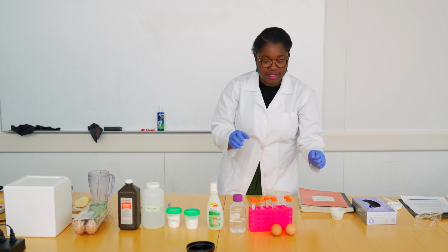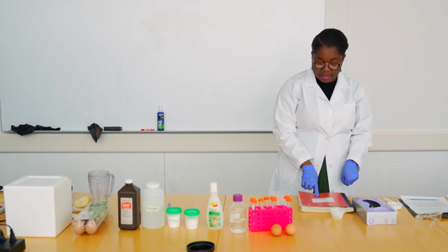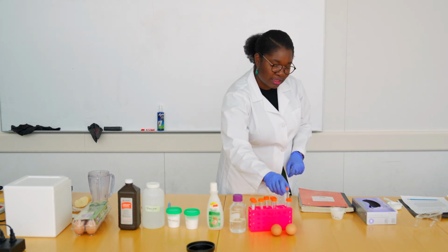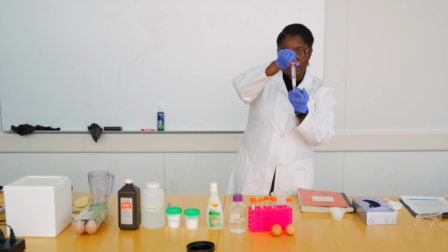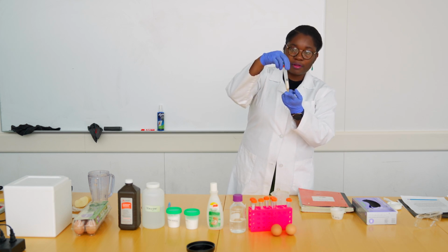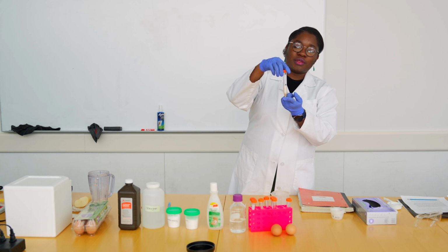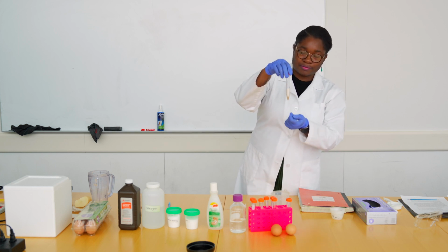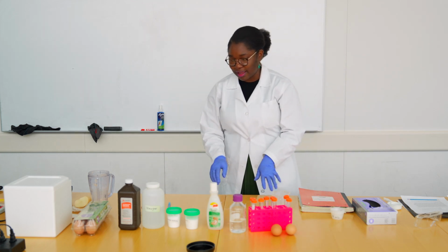And while you're doing all that, make sure you're always recording what you did in the notebook, because in the tube I had about 1 milliliter of potato juice, to which I added 10 drops of the hydrogen peroxide. So I have my table in here already recorded with everything that I've done.